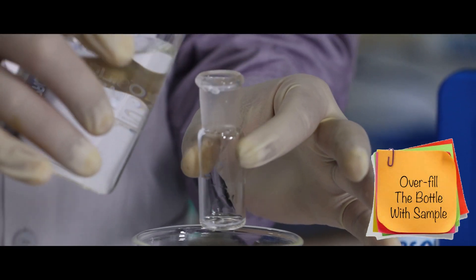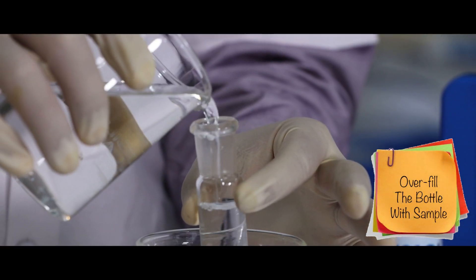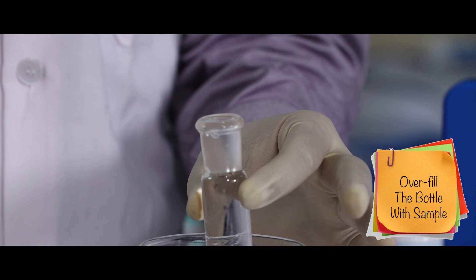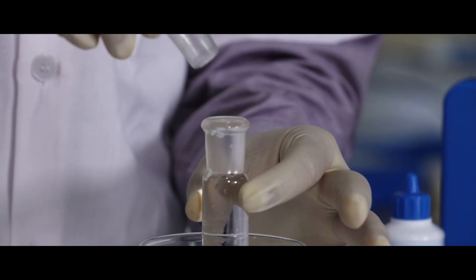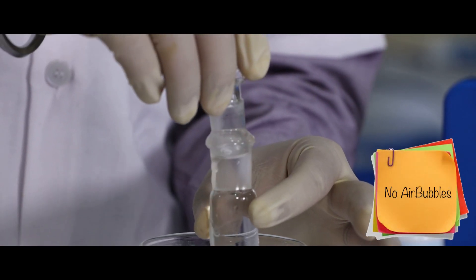Overfill the DO bottle with sample and place the stopper, ensuring no bubbles are trapped inside.